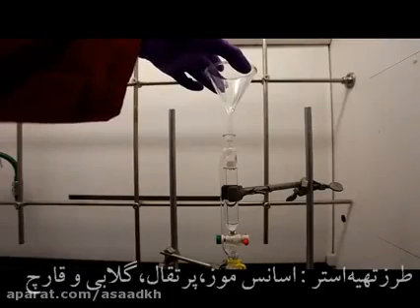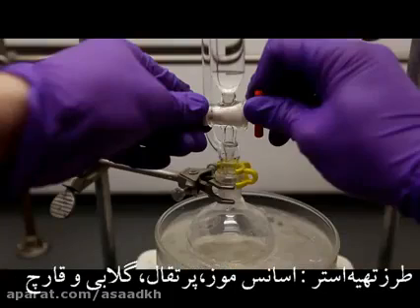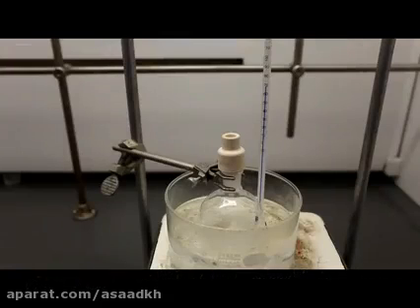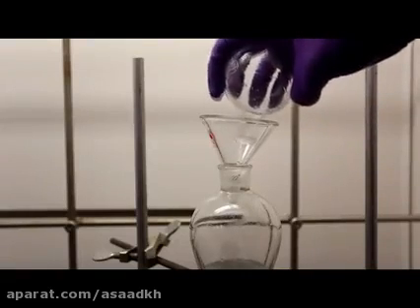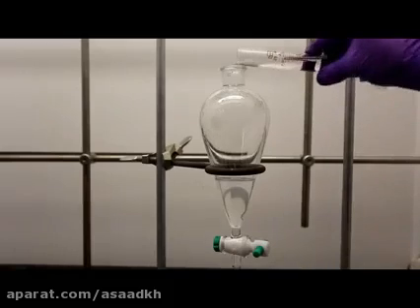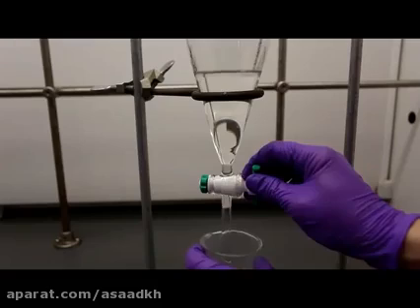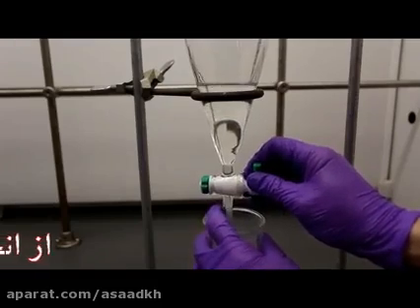In general, esters have very particular odors, and they are responsible for many artificial and natural flavors and smells. In this video, I'll be making pentyl acetate, also known as amyl acetate, which has a distinct candy-like banana smell. The reaction carried out in this video is a basic acetylation of an alcohol.